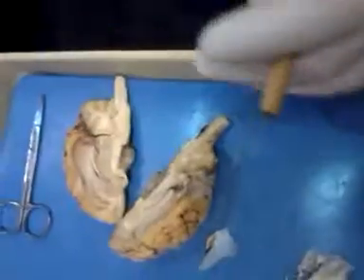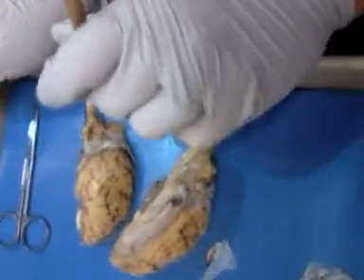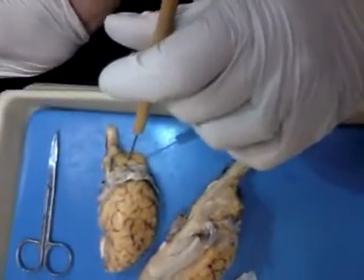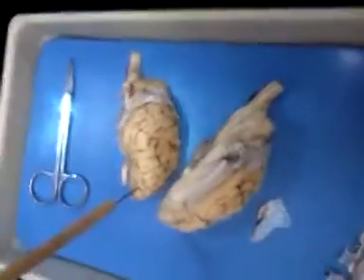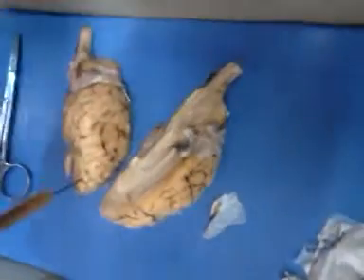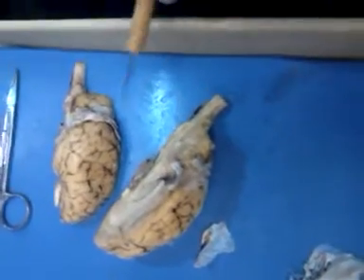Alright? And so they may have one that's turned over like this, and that would be your cerebellum. And then if they say name the lobe, the frontal, because it's way up here towards the front, towards your olfactory, because your brain stem is going down your back.